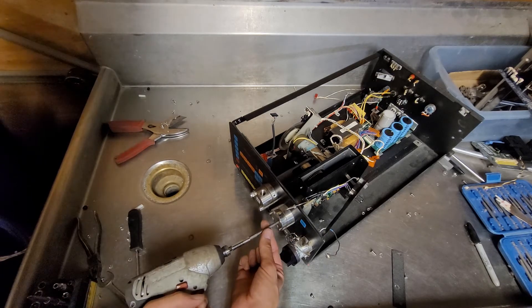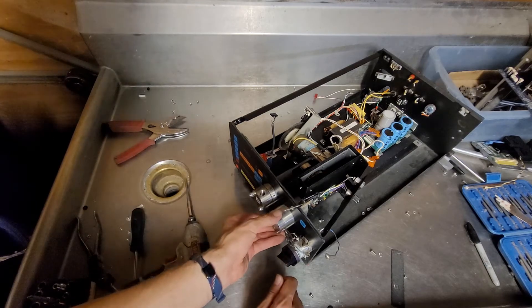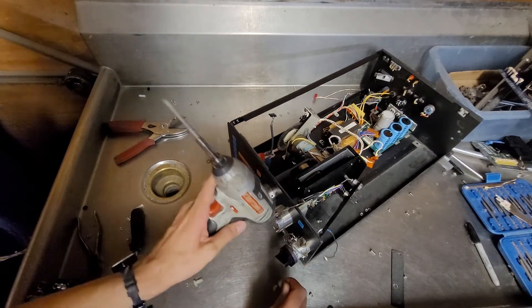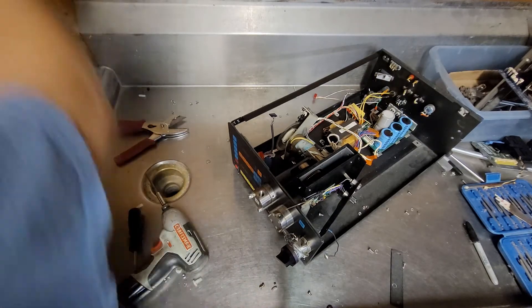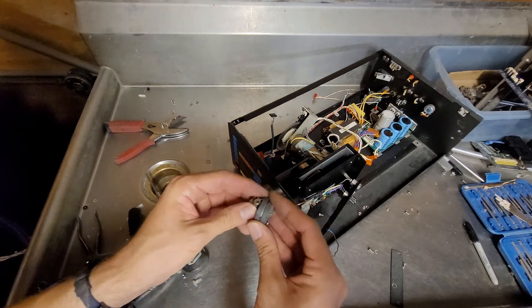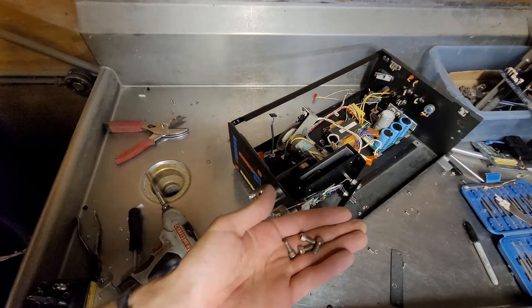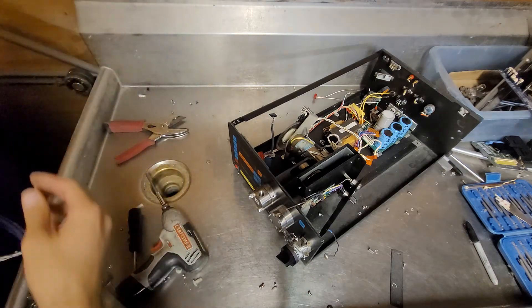It might not be spring-loaded. A little stainless steel as well. But I like saving these kinds of screws for no particular reason — there's a lot of stuff I'd save for no good reason.